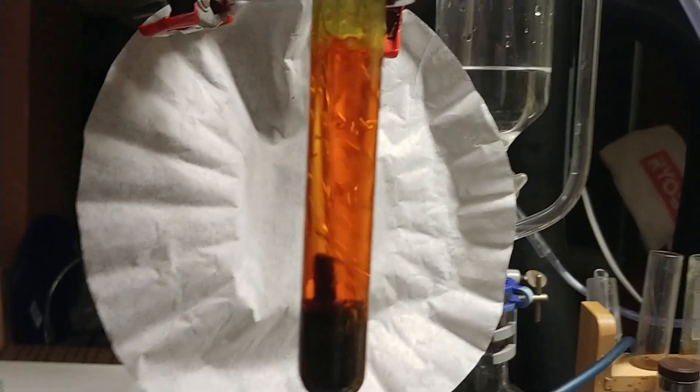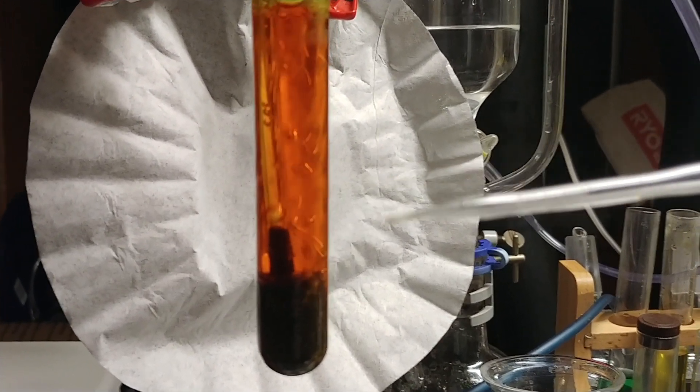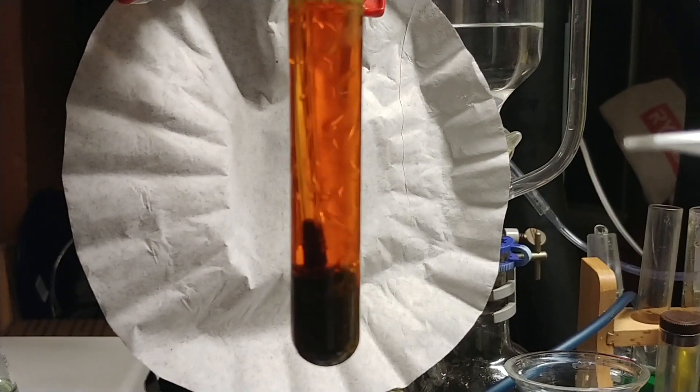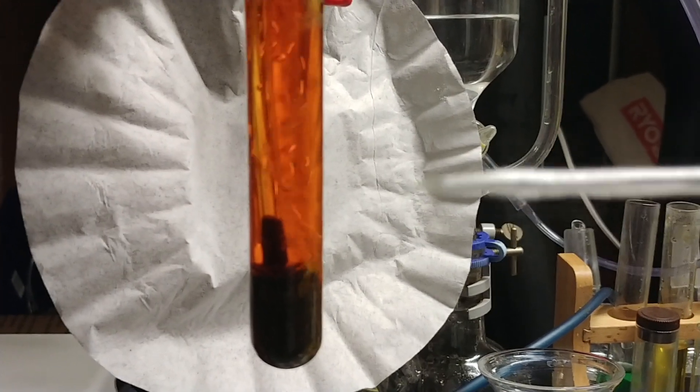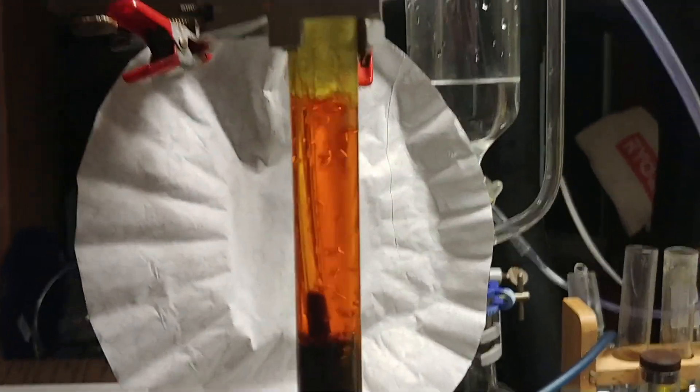What I've done here is gotten a fish tank air stone, which seems to help out a little bit. I've been using this glass tube for just blowing straight air — I've used it before with oxygen. It creates really small bubbles with its nice small opening, so it works well.